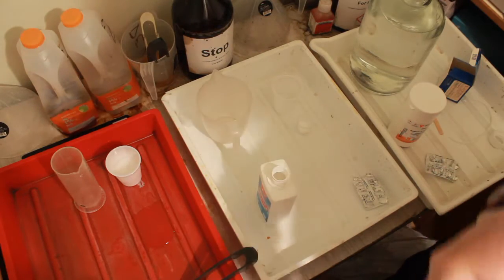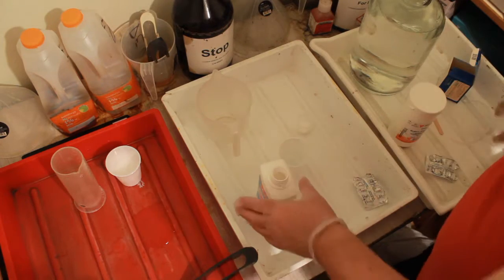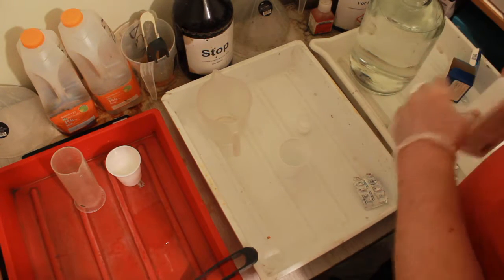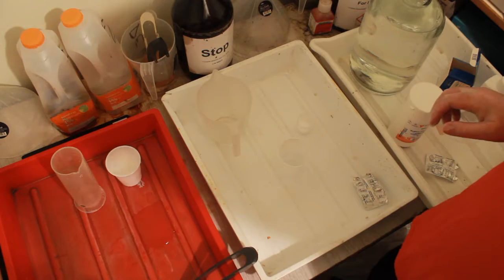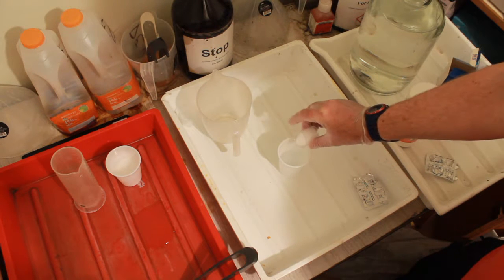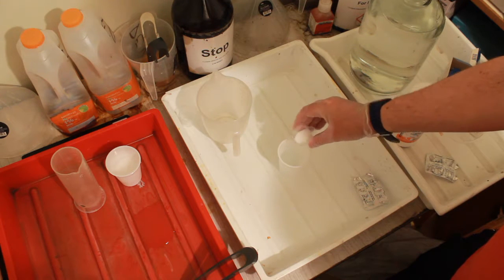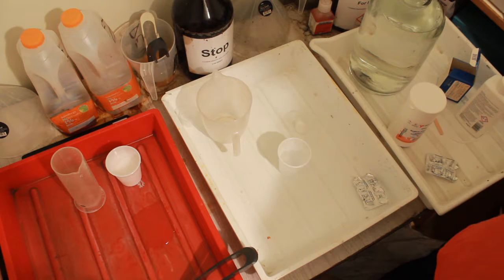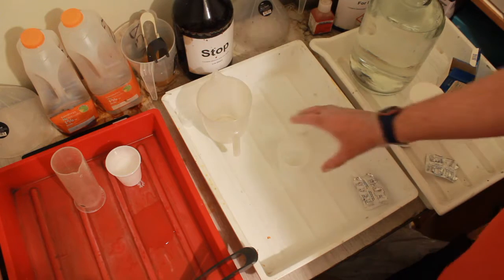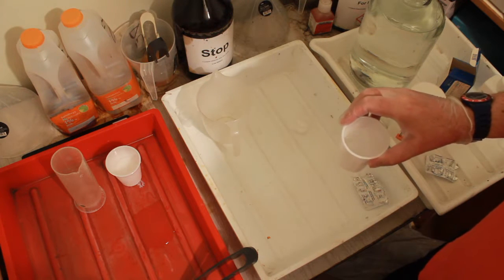That's another used thing that can go over there. Where's this little case go? All right. I've no idea how it's going to react with the water. We'll put the lid on because it's hygroscopic. Come back next time there'll be a big lump of it. The whirring noise in the background is the dehumidifier. Crackling noise was me adjusting the microphone cable. Right, here, keep my eyes out of the way I suppose. Sprinkle that lightly into there. It's not a lot, I'm not expecting it to get mega hot, but we'll just let that little bit sit there first and see if that's getting warm. Yes it is, yes it is. Swirl it around to help it cool.